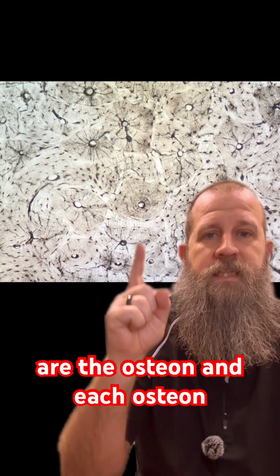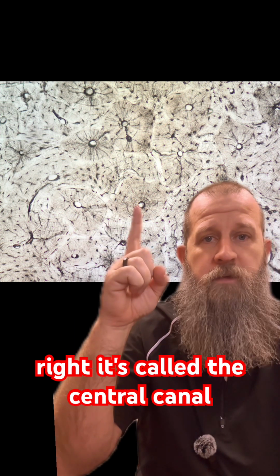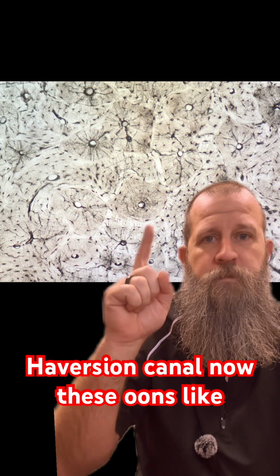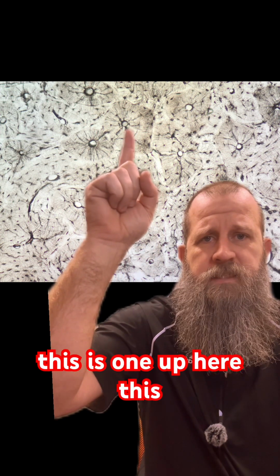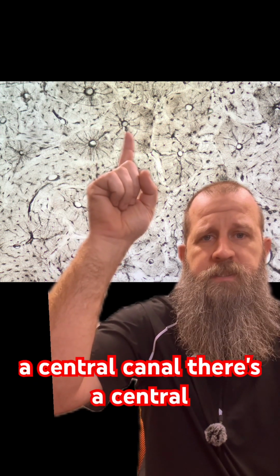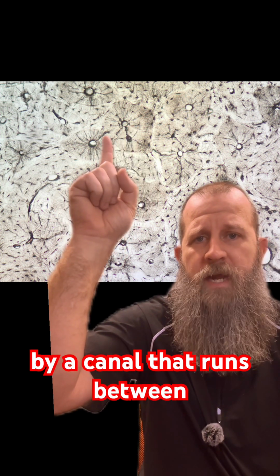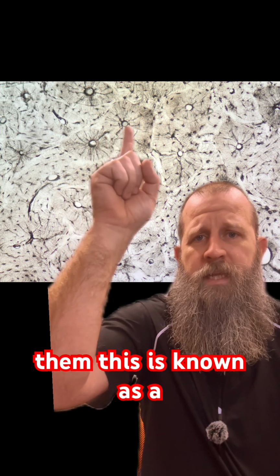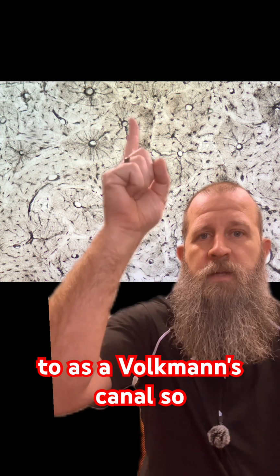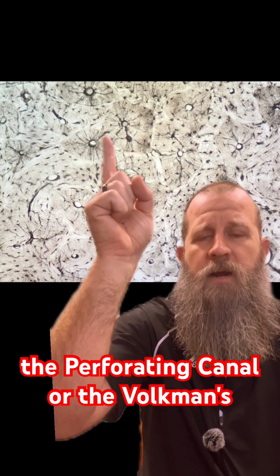Each osteon has a canal that runs through the center of it. It's called the central canal, or some people call it a Haversian canal. Each osteon has a central canal in the center. Then these central canals are connected to one another by a canal that runs between them. This is known as a perforating canal, or what some people refer to as a Volkmann's canal. So you have a central canal within the osteon, and then the perforating canal, or Volkmann's canal, that runs between them.